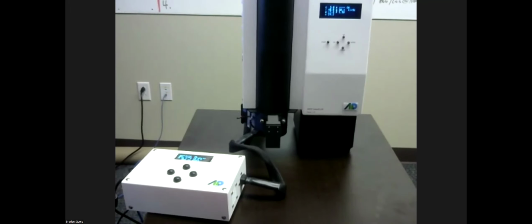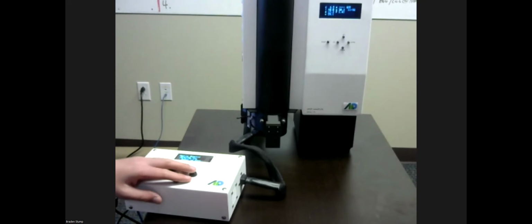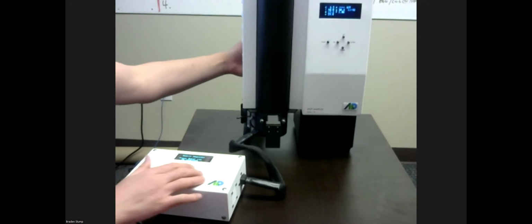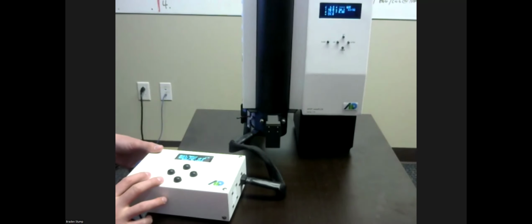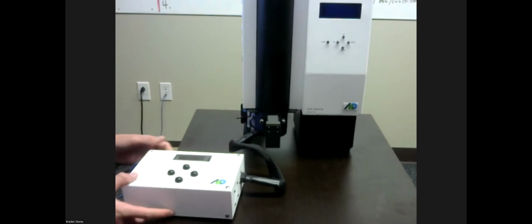With that, though, what I'm going to do last here is show how we can access log files on the instrument. I'm going to go ahead and press escape to abort our sample. And it makes you ask enter to confirm. It tells you you aborted your sample at a certain time, turns the pump off on the sampler. And then I'm going to go ahead and turn the TLC off, as well as the spot sampler off.